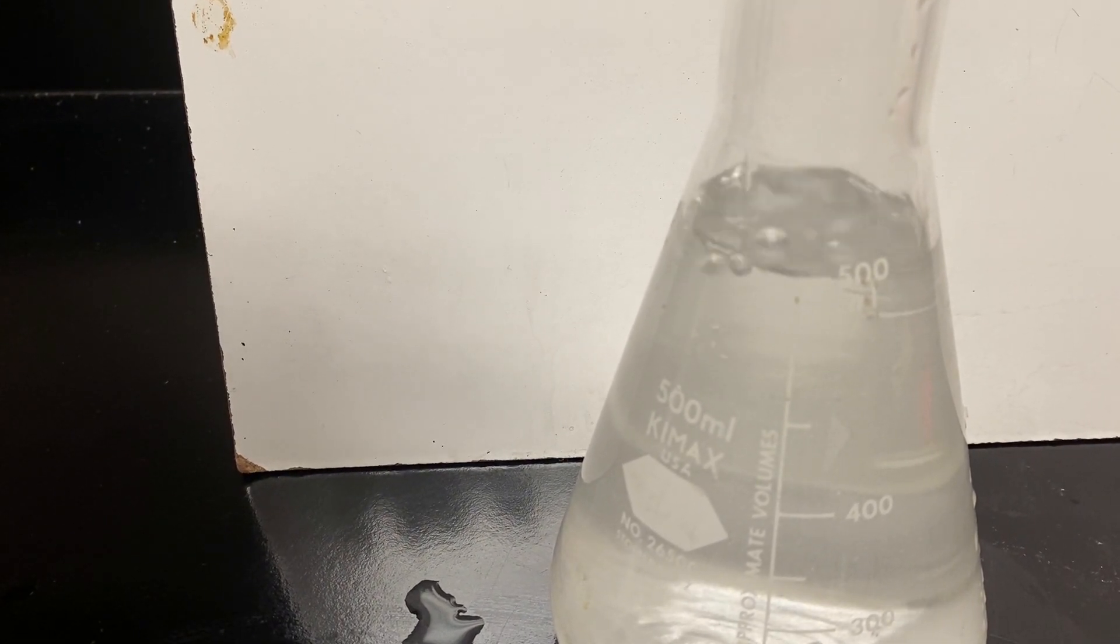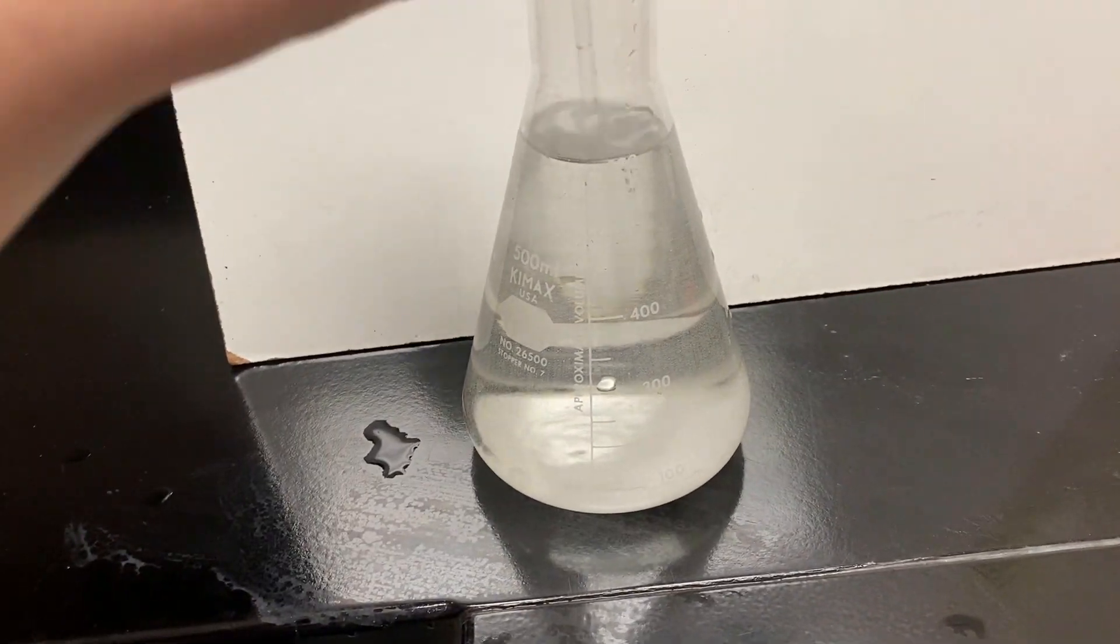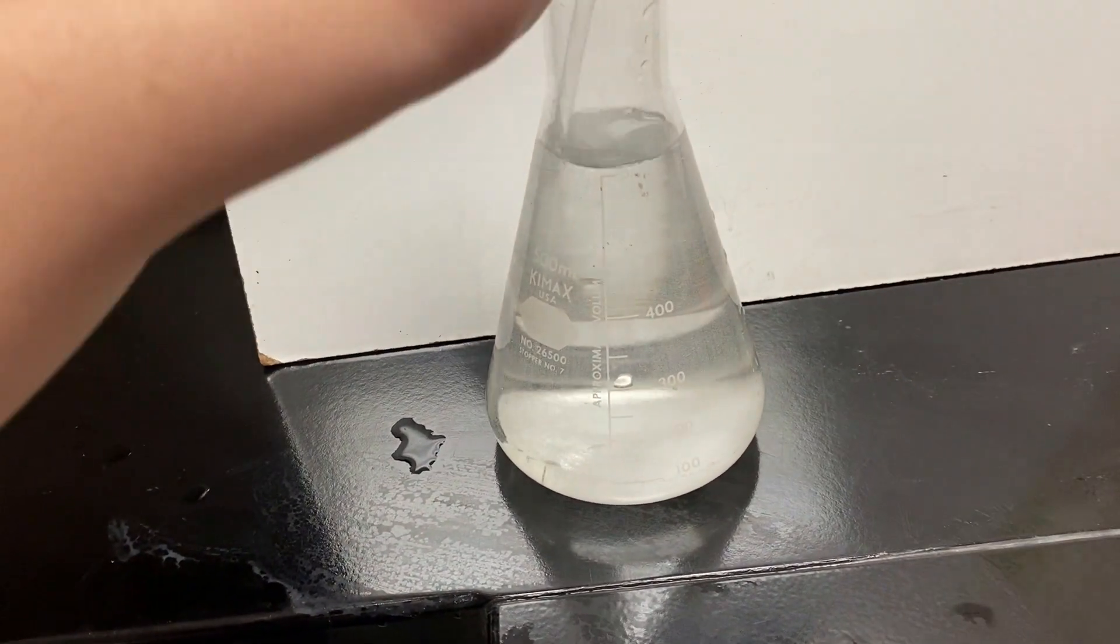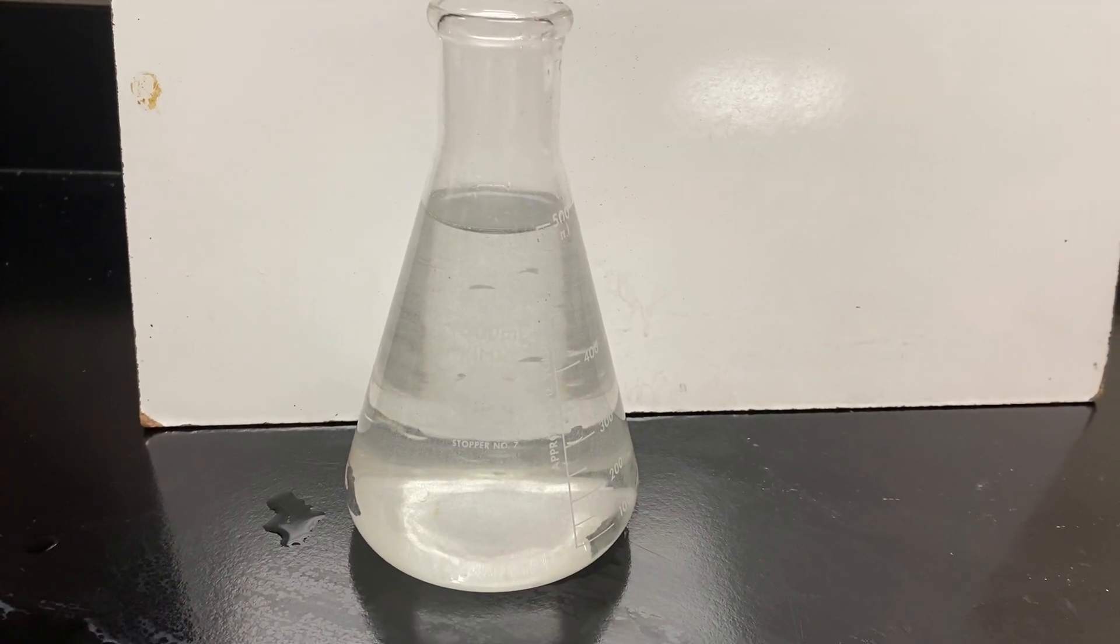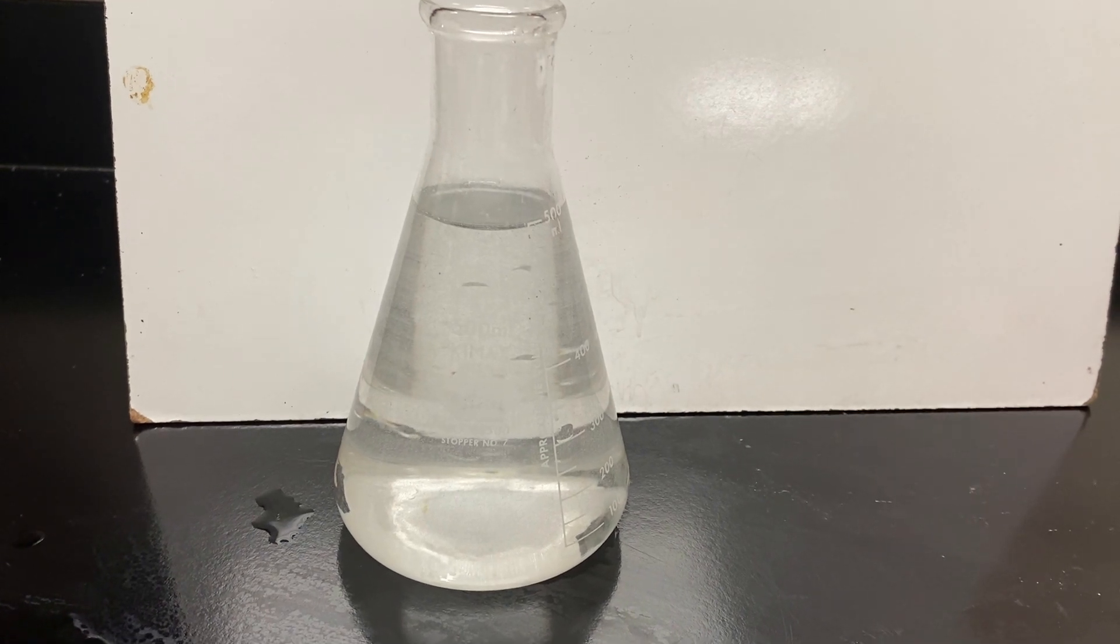So once you get it up to there, all you have to do is give this a really good stir. You can even put a cork on this or a stopper and give it a shake if you want, but once it's well dissolved and incorporated, you have prepared your solution and you are good to go.